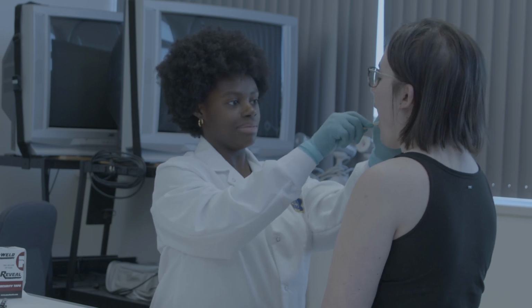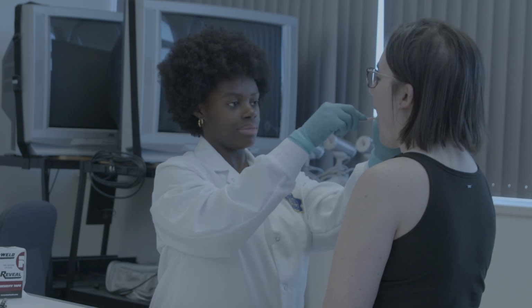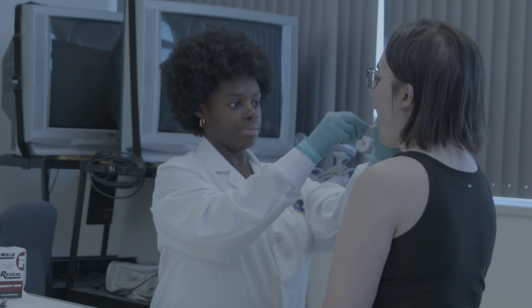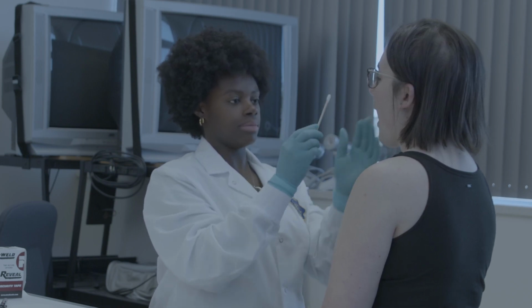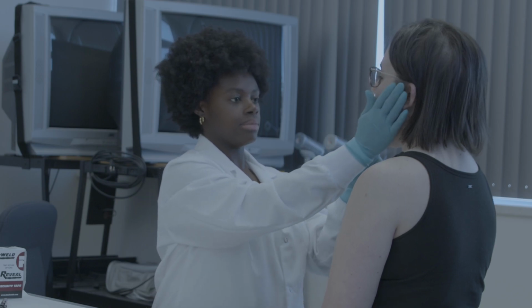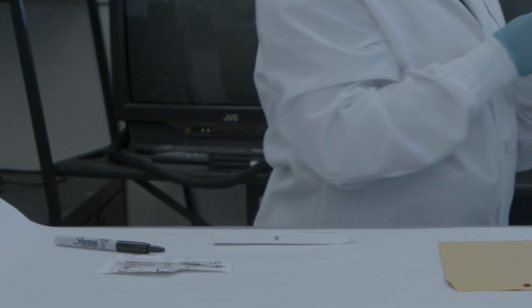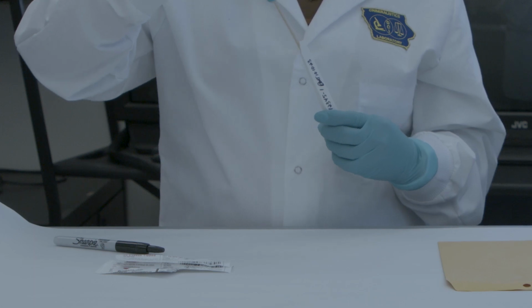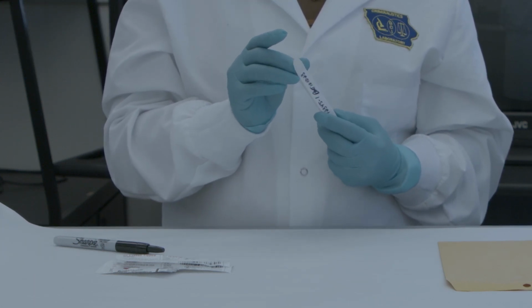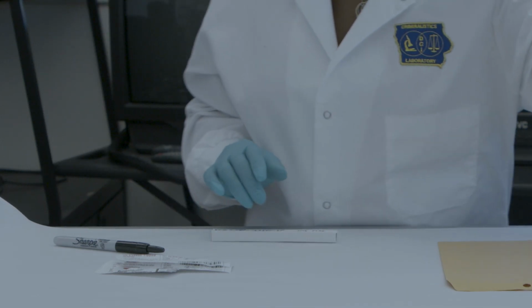Make sure to twist the swabs around to ensure all parts of both swabs get an equal distribution of buccal cells. With the same 2 swabs, move over to the other cheek and repeat this process. Once finished, place both swabs in the prepared swab box in the same direction. Close the remaining end. Apply evidence tape to both ends of the swab box.